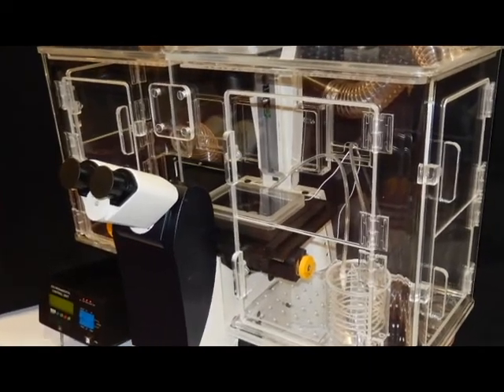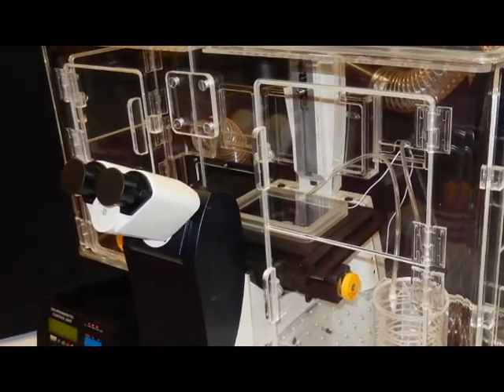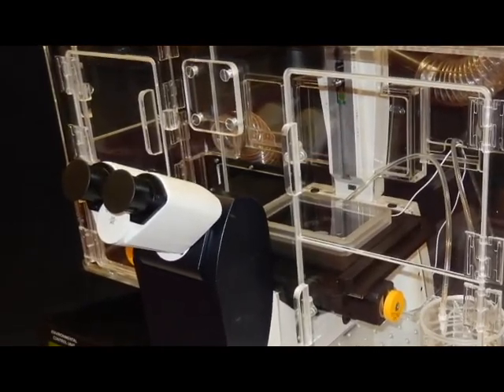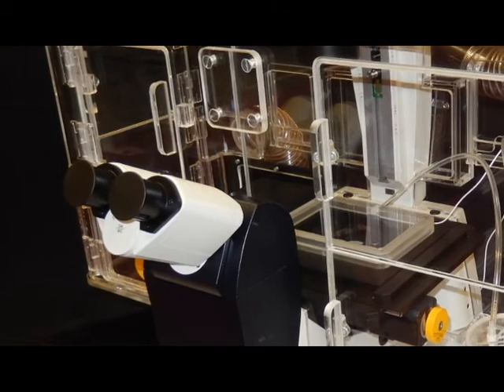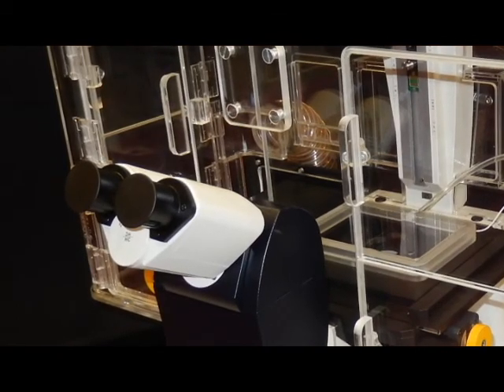Hi, I'm Lisa from World Precision Instruments and today Barney and Kelly Boyce are going to demonstrate how to set up an in vivo scientific microscope enclosure that is available from WPI.